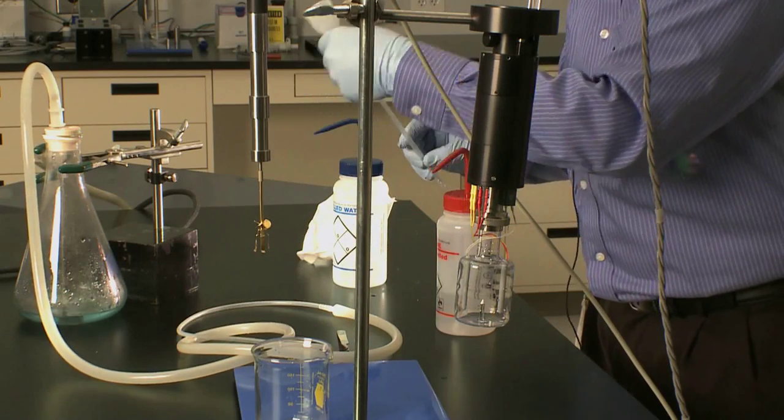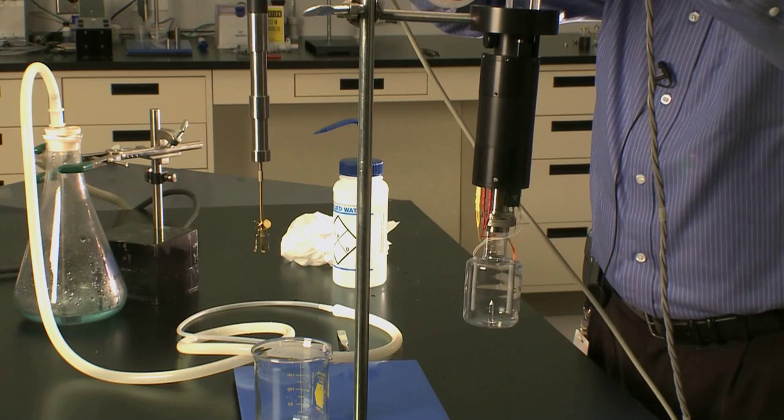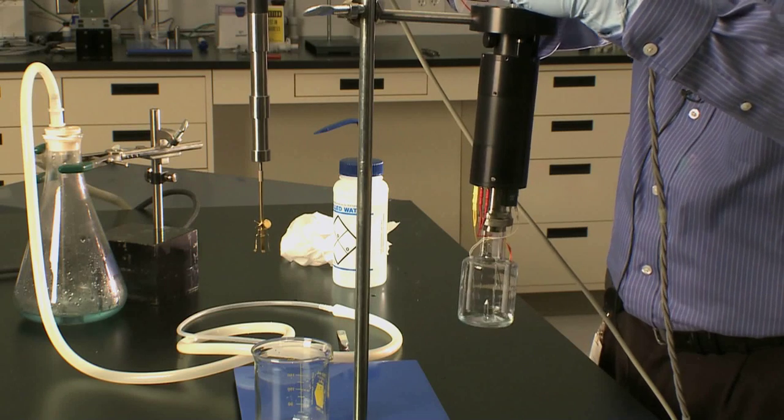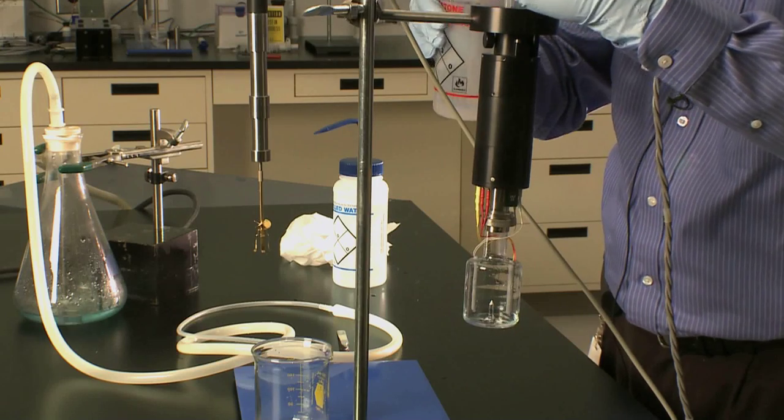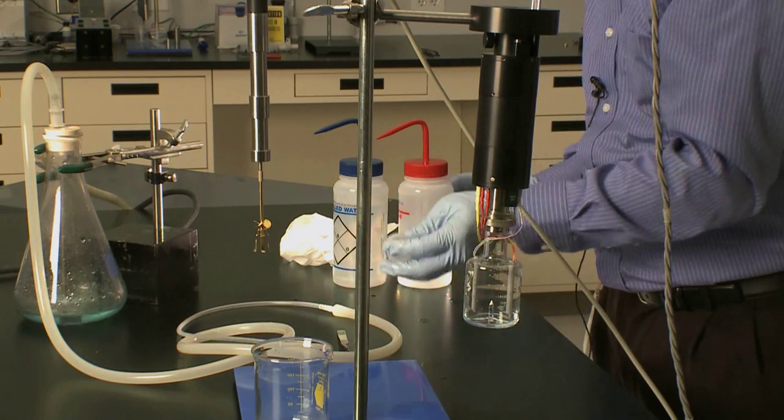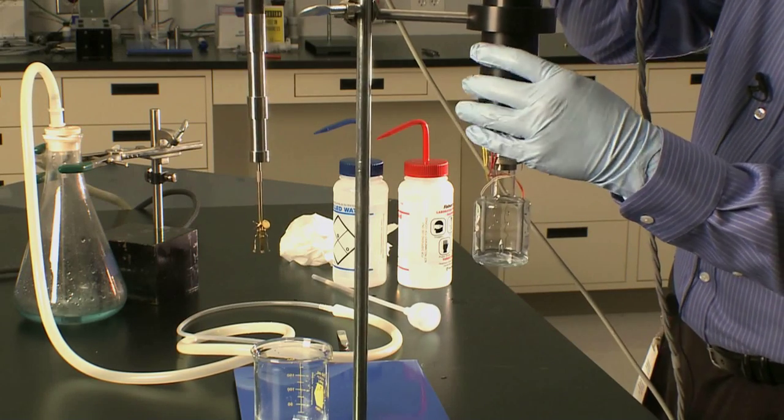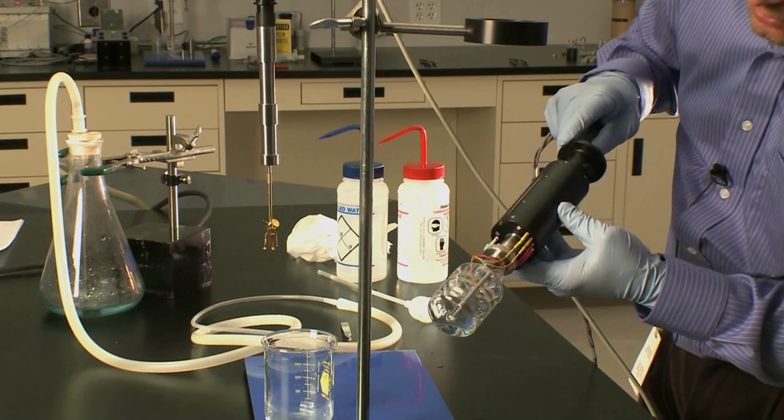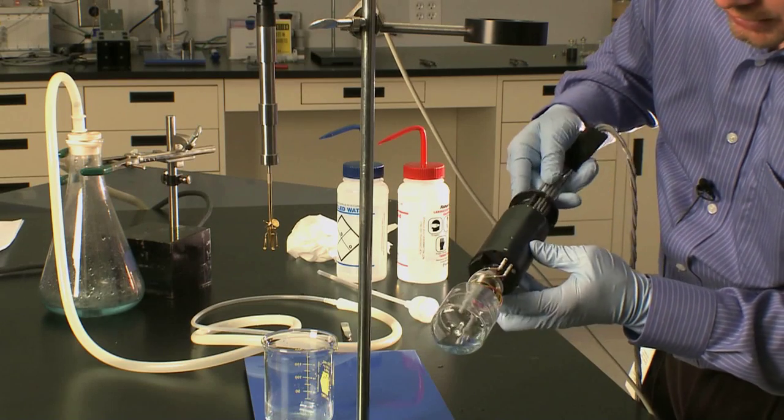Use this same funnel with a little acetone, maybe one time or two times. You see the acetone goes along the sides. If you can't get the acetone to run along the sides, you may need to take the solution calorimeter out of the ring stand and swirl around the acetone, making sure not to go up past the neck of the glass because it's a Viton O-ring and it will swell with acetone.